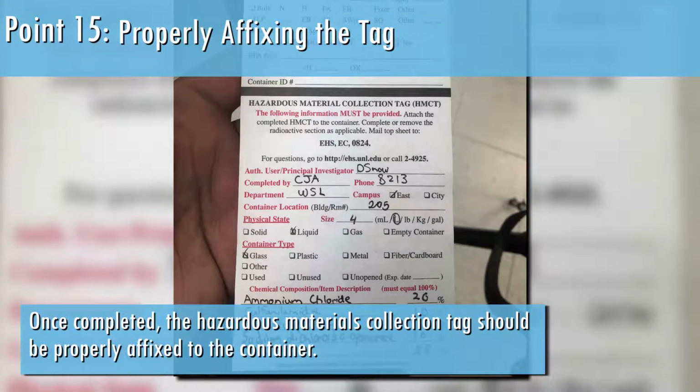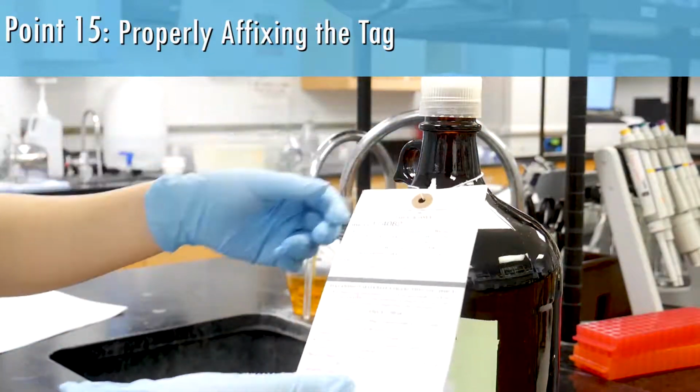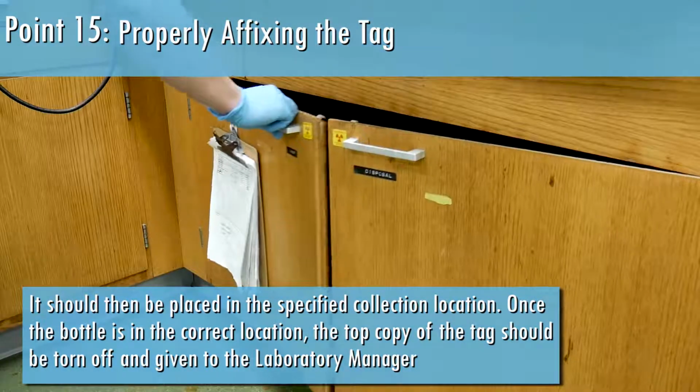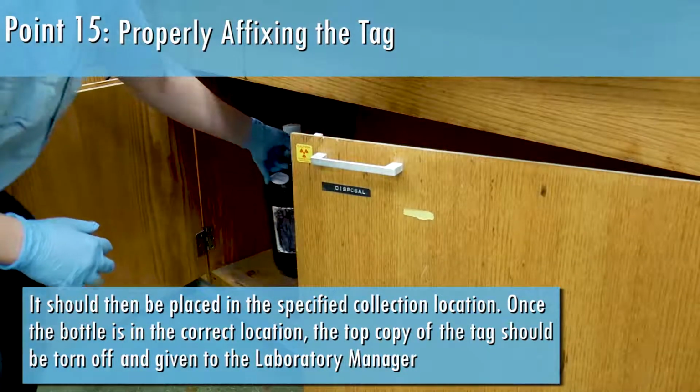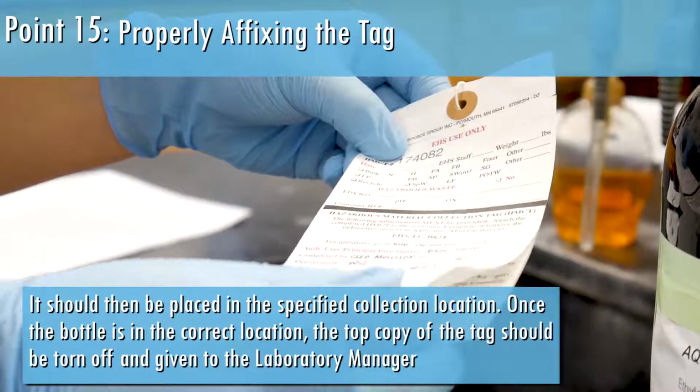Once completed, the Hazardous Materials Collection Tag should be properly affixed to the container. It should then be placed in the specified collection location. Once the bottle is in the correct location, the top copy of the tag should be torn off and given to the laboratory manager.